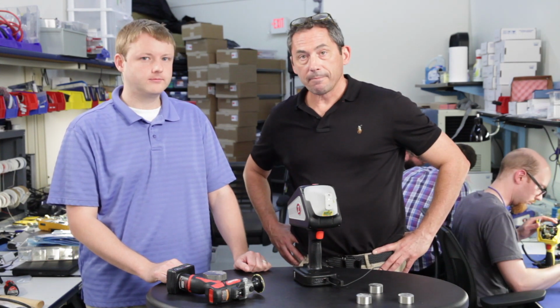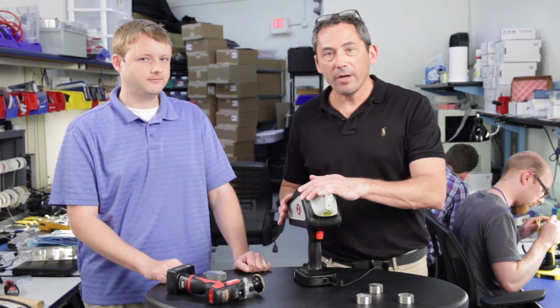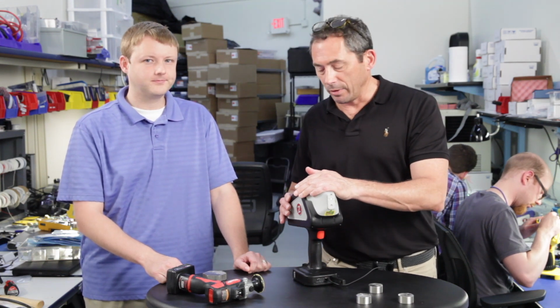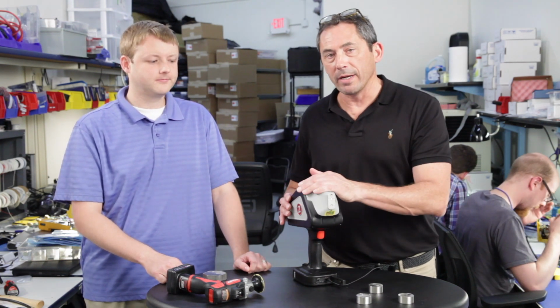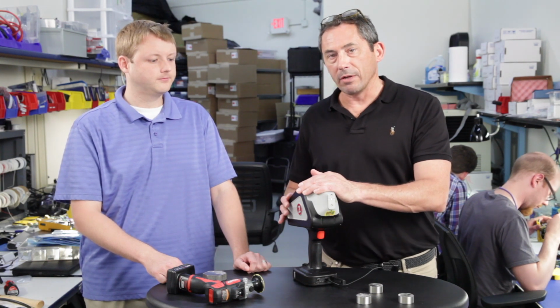Yeah, so thanks a lot. So that's it. That's the latest software. Again, thanks to a bunch of you OES guys out there that provided us with some great feedback when we met up with you a couple of weeks ago, and we look forward to showing everybody this new software down there next time.